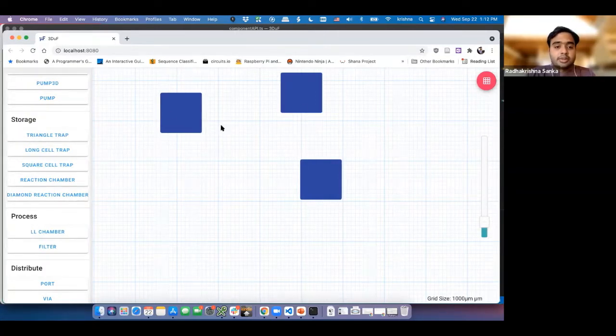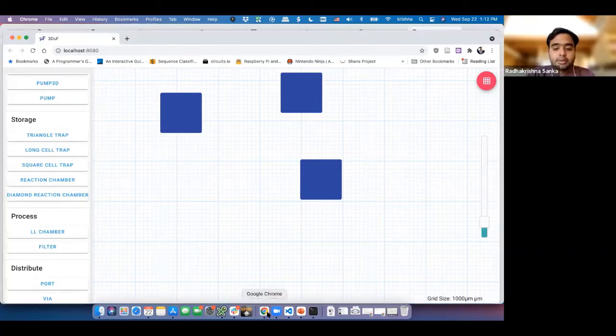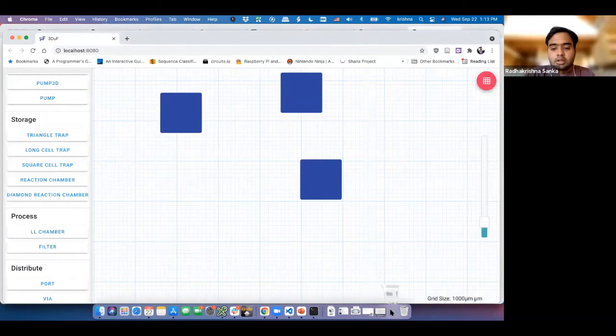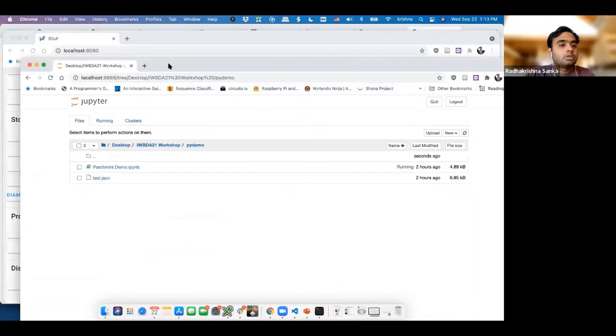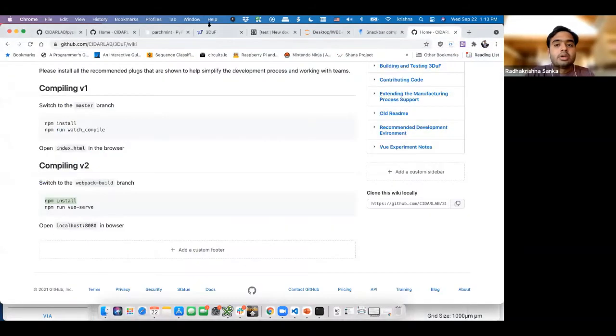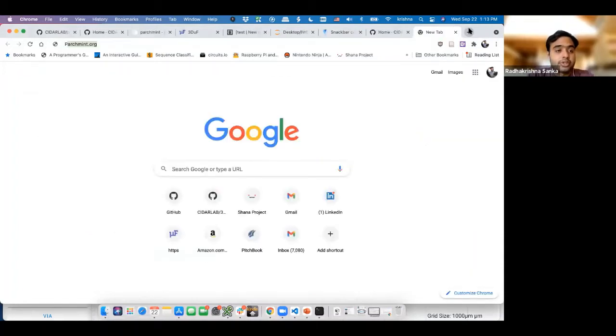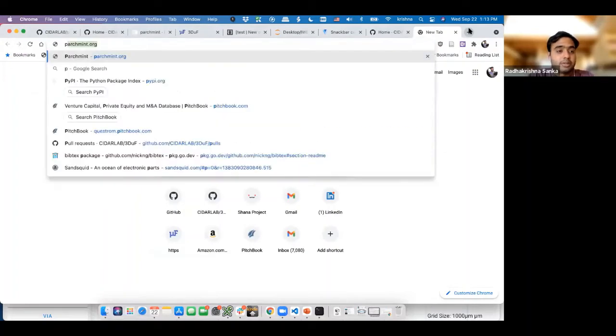So now that we dropped these 3 different things, now we need a little triangle hole inside it. In order to do that, you might be wondering, how do I go about doing the drawing code? Is there an easy way to learn how to do it? That's where the fact that it's open source software where we use other open source libraries really comes into play. What we do in 3DuF is for all the drawing code, we use a library called paper.js.